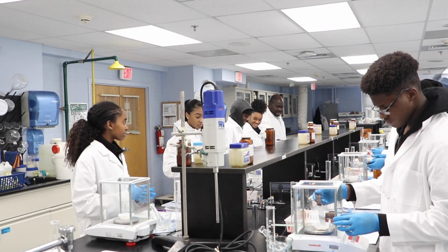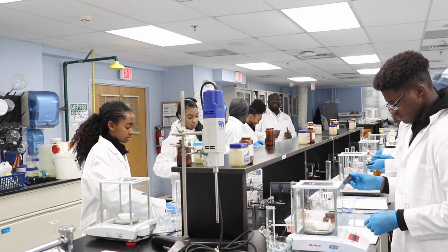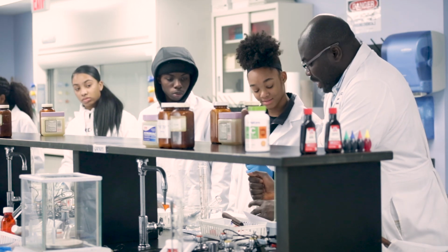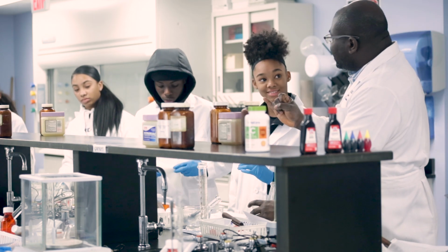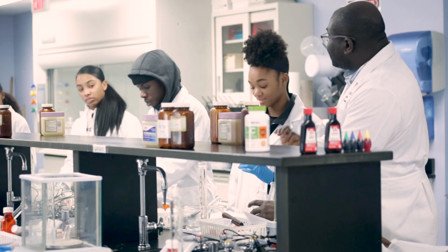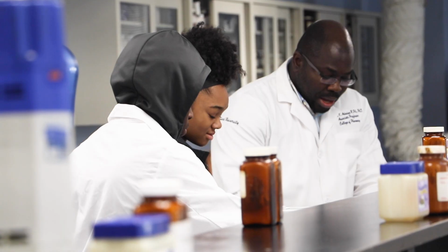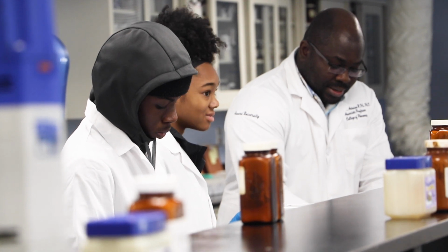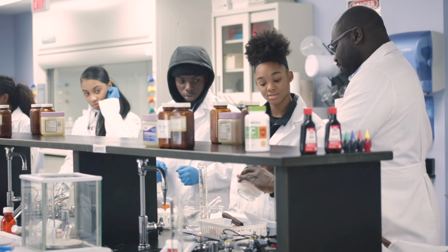For those of you who are working on the ointment, when it says triturate, that is a technical term, which means you mix by grinding. So triturate is a term that means you're mixing and at the same time you're grinding, you're reducing the particle size of your powder. So now you can see it's in clumps. All I'm saying is that now this is how to triturate. Now what do you see? It's very fine, smooth powder.